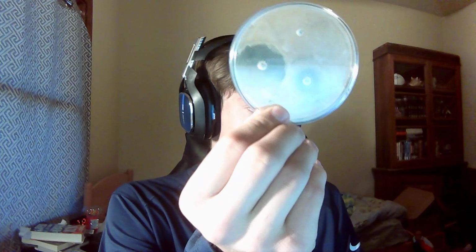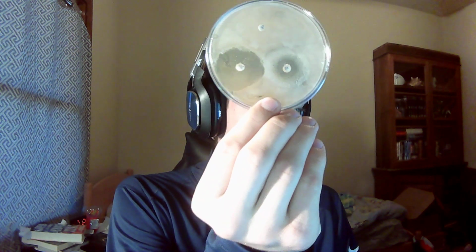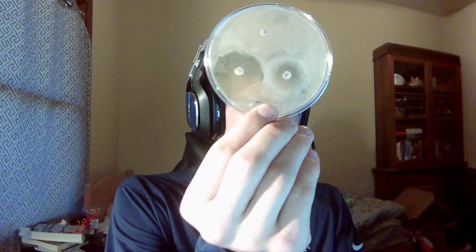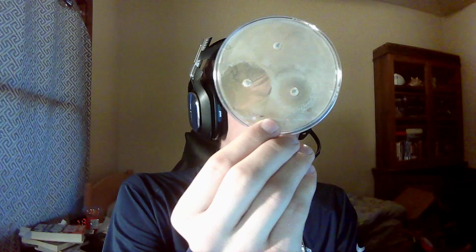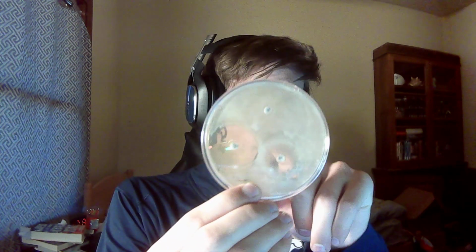But with that being said, let's get into the results of it. As you can see, there's 3 tablets in there. You got one towards the top, and 2 towards the base. 2 circles around the 2 on the base, a small and a big one. So the tablet on the top is a penicillin tablet. The 3 different antibiotics in here are 2 different types of antibiotics.